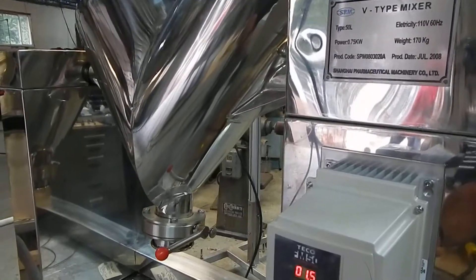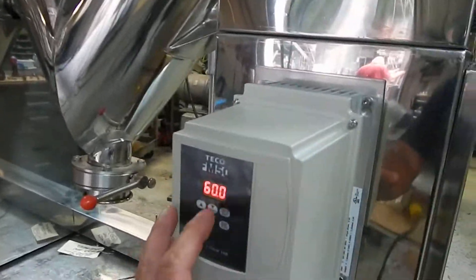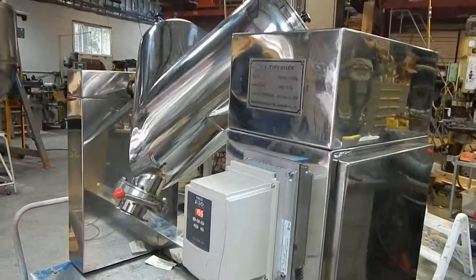We're going to hit the stop button right there — and it's almost an immediate stop. So after a few times, you'll probably get the timing down real good.